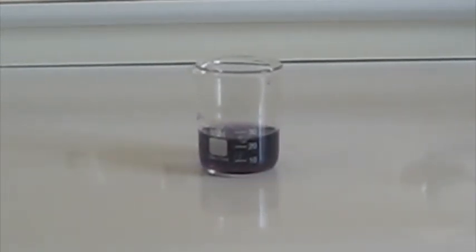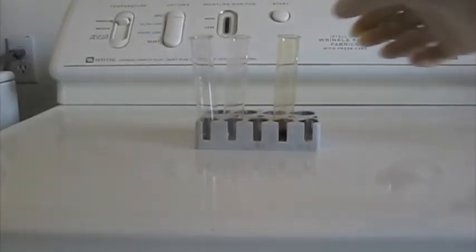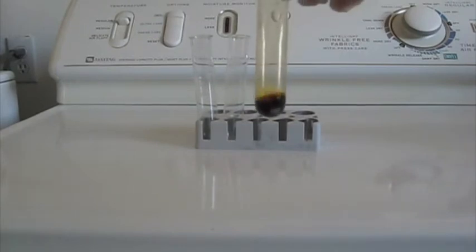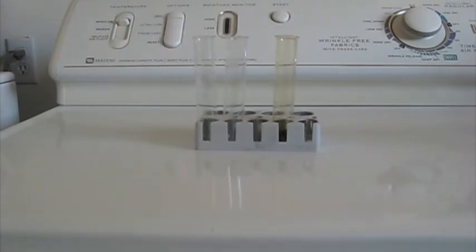Now I'll show you how to perform this. First off, start with a solution of iodine and alcohol. Iodine dissolves in alcohol, but not in water. You also need two test tubes, or beakers, or flasks.